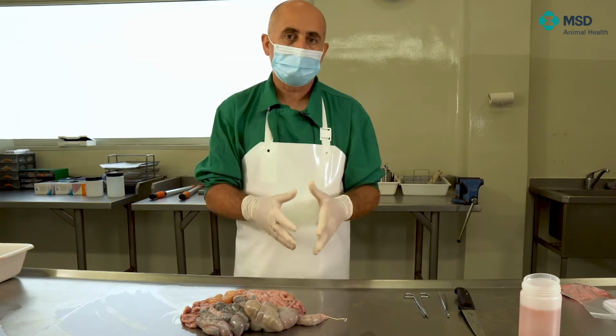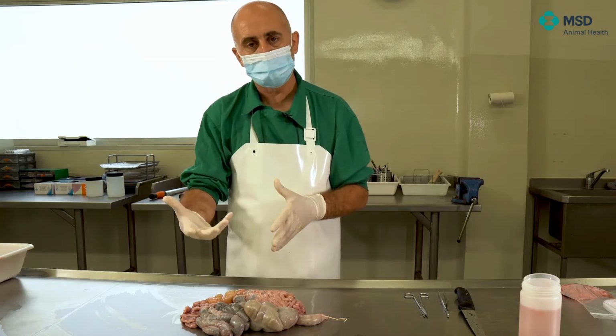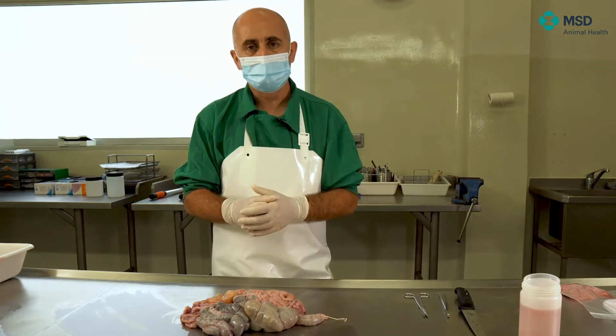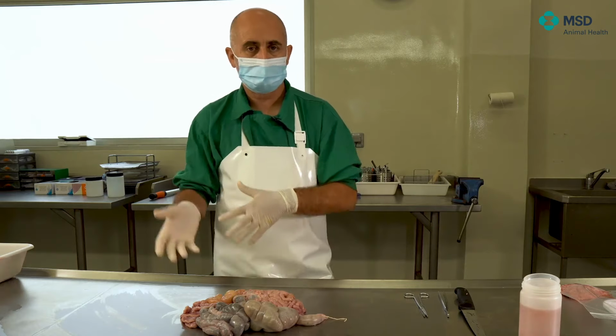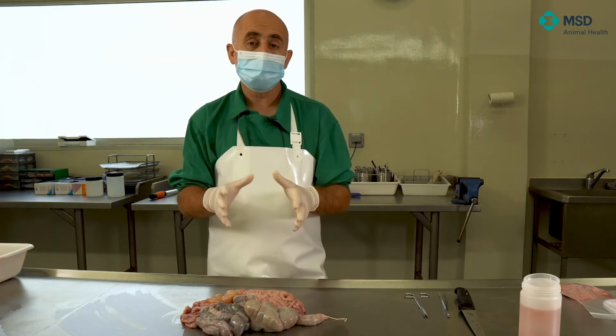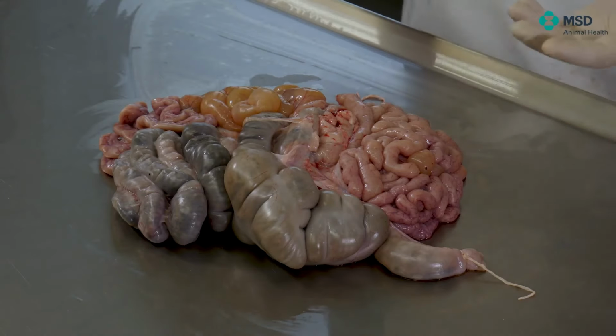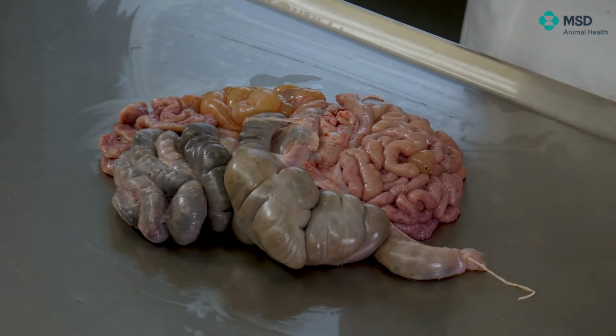One could be the porcine intestinal adenomatosis, but there are other forms, which is the hemorrhagic form, and then there are very scarcely seen forms, which are the necrotic enteritis and the regional ileitis. But then it's very important to locate specifically the presence of the ileum.